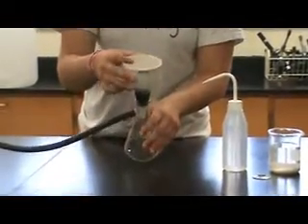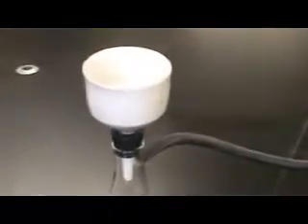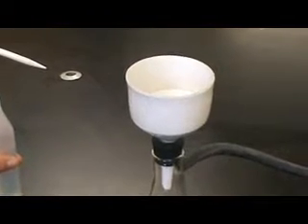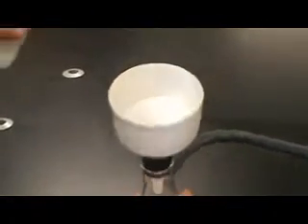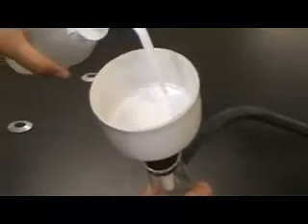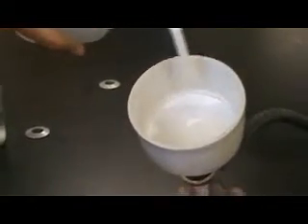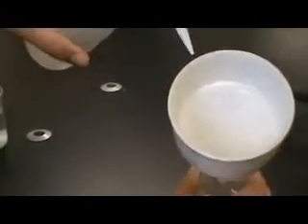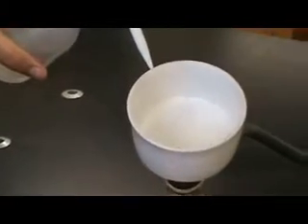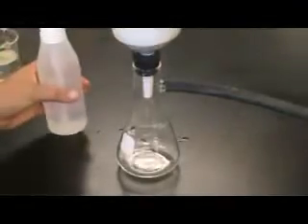Wet the filter paper with DI water and turn on the faucet to test the vacuum filtration. If your vacuum is working, you should be able to see the perforations of the Buchner funnel through the filter paper, and excess water should be draining into the flask.